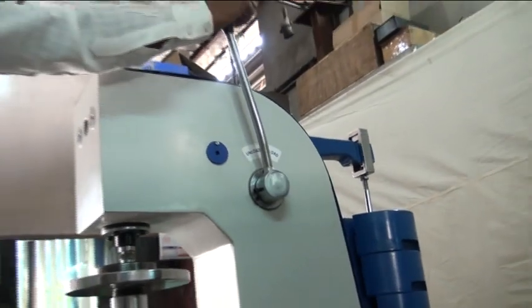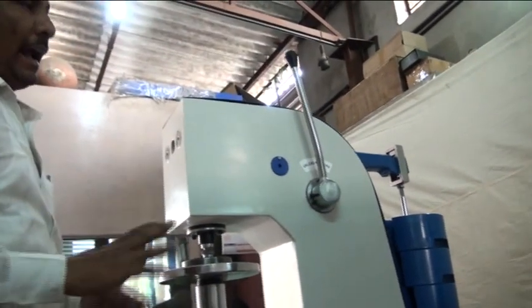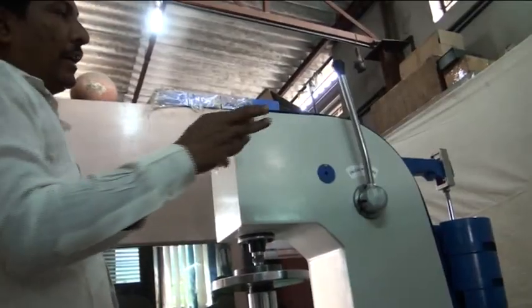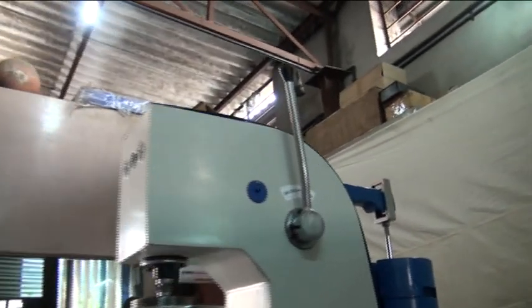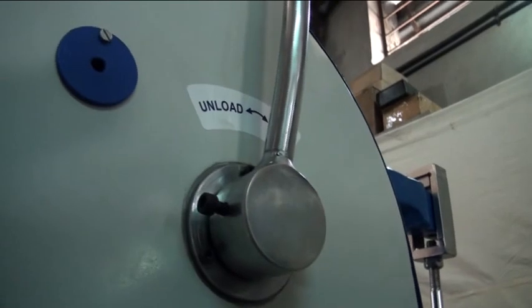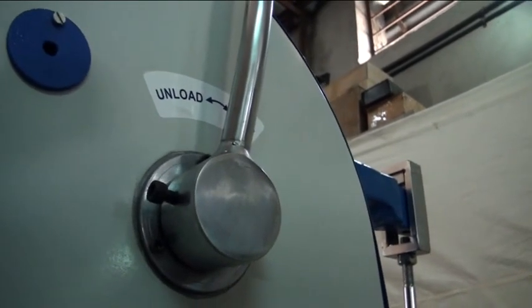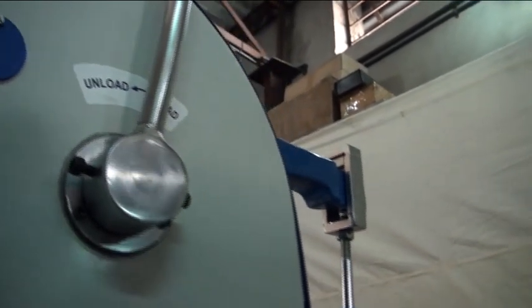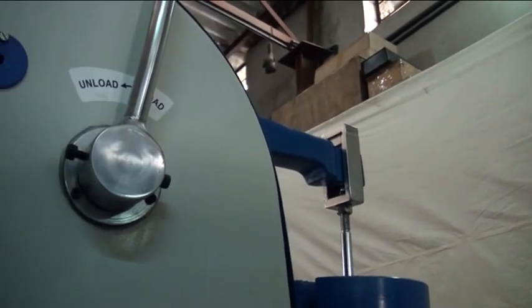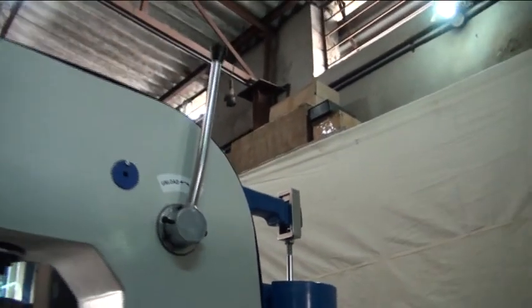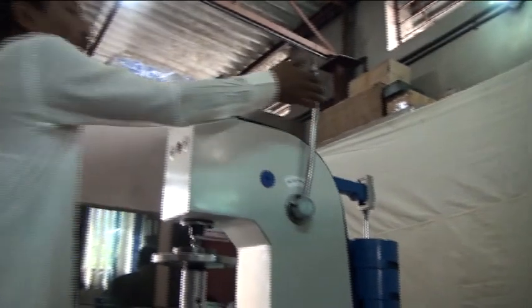Up to here and remove the hand for loading. It will be automatically loading. This is the loading position. Then keep 10 seconds straight for here and remove the load.